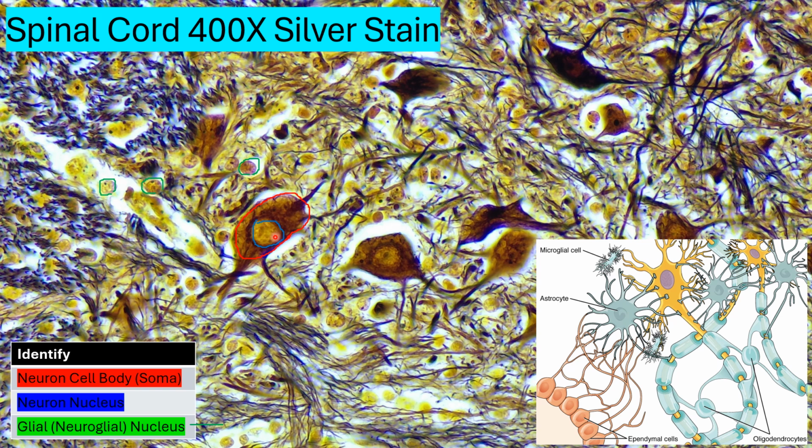And conventionally, scientists thought that these glial cells outnumbered neurons 10 to 1. And obviously, we see that here. It was conventional wisdom among scientists long ago, but newer studies are showing us that it's closer to a 1-to-1 ratio. But that's beyond the scope of this video and how they determine that. But it's fairly obvious with our slides that glial cells are going to outnumber neurons.